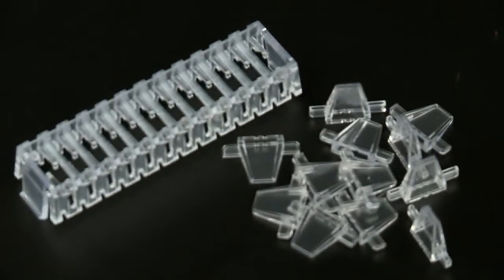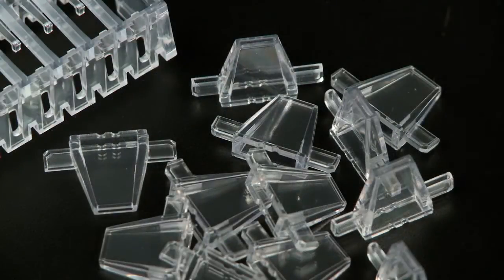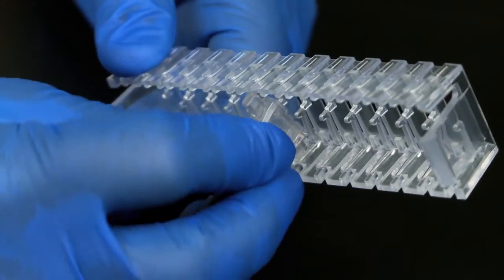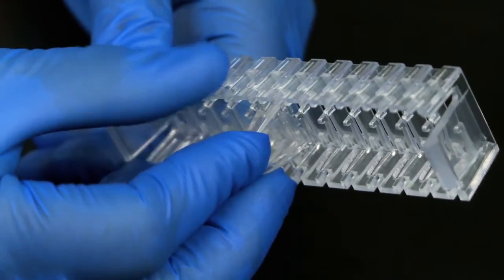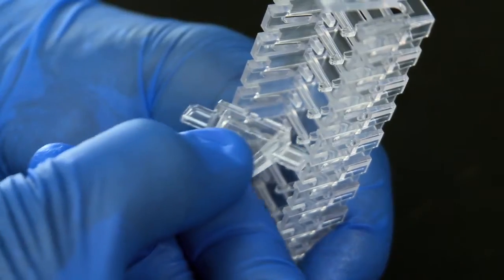Assemble the sample loading cup holder to hold as many cups as you would like to use for loading. The cups fit into the sample cup holder via arms on the sides of the cups that fit into holes on the holder.